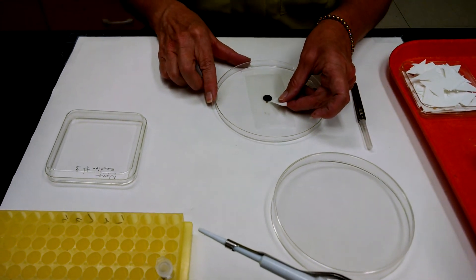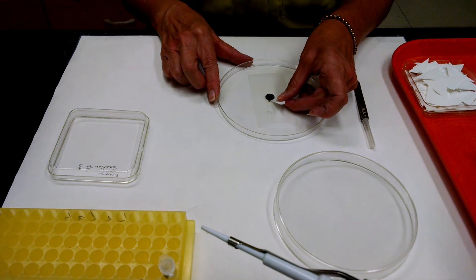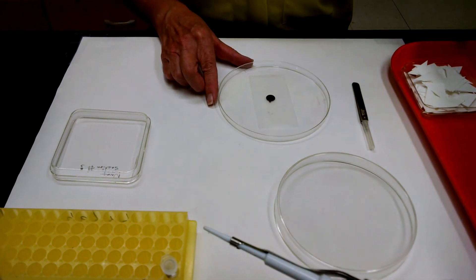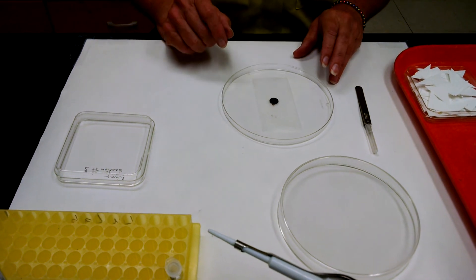And then we will wick off the uranyl acetate. Dispose of the Whatman paper. And we're done.